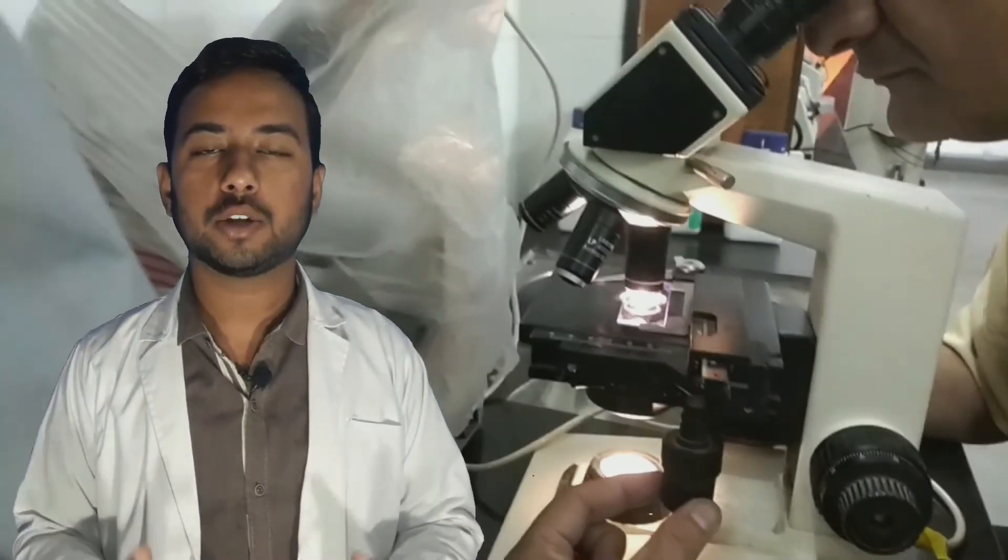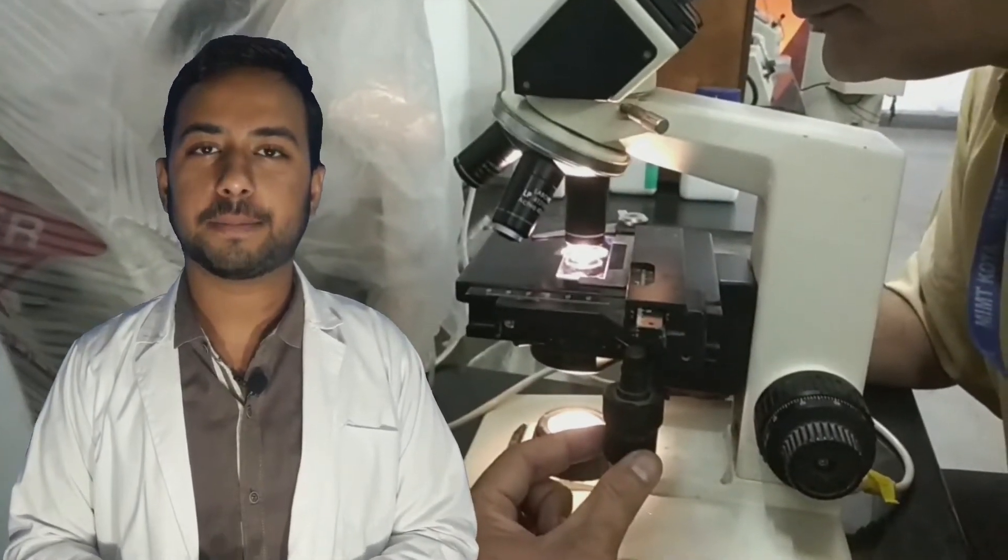In this video, you are going to know about endospore staining step by step. So, let's get started.